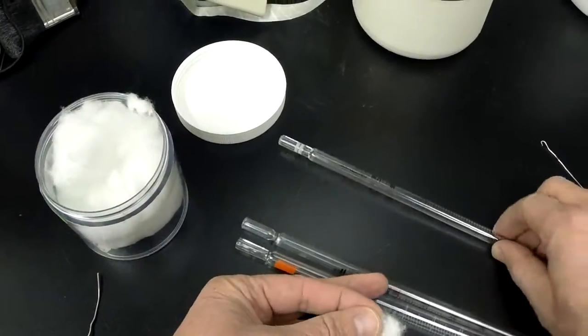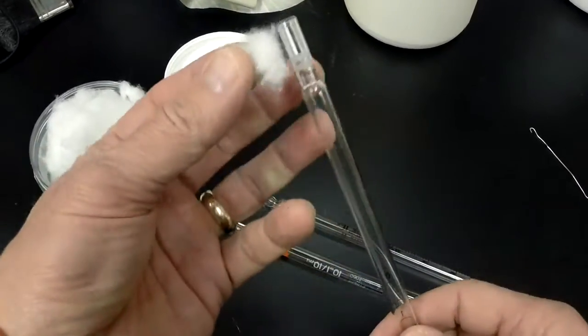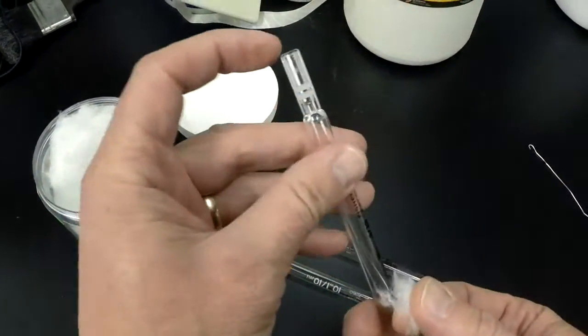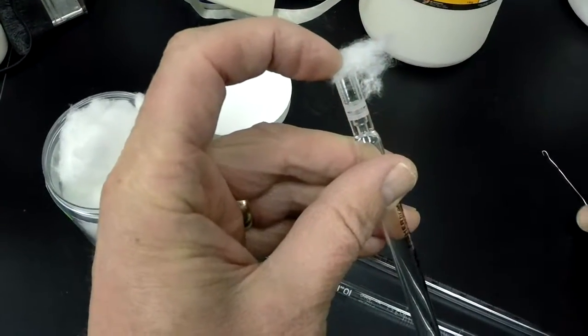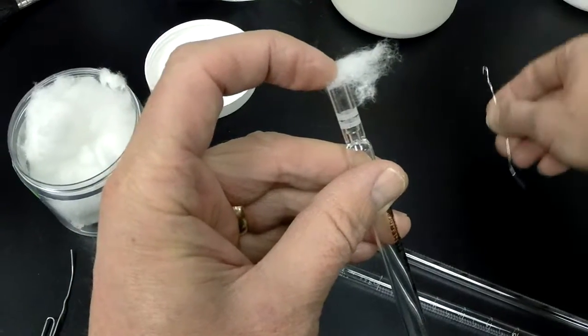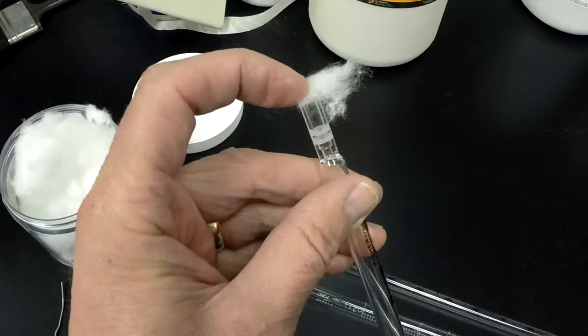Then you take one of these that's been designed for the process and hold it on one side here over the top of that. What you're going to be doing is actually dragging that down inside.